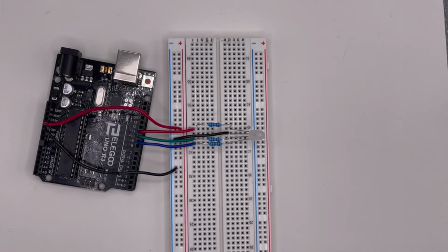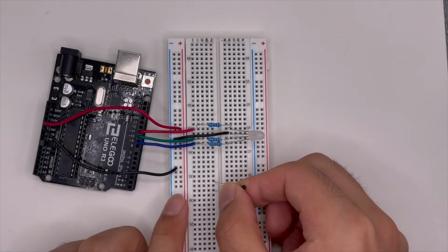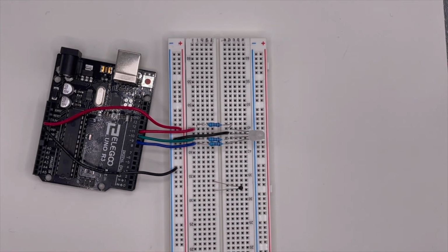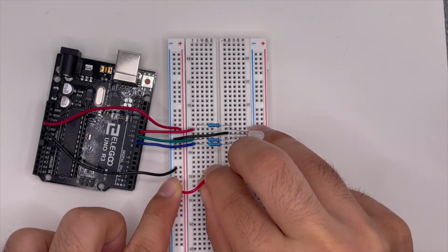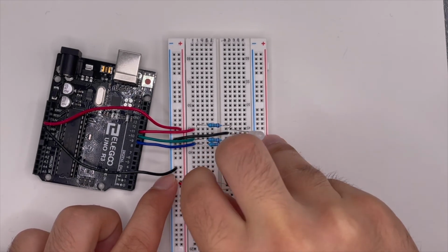It functions as a resistor, so the order doesn't really matter. We can just place it like this, just anywhere you want, as long as the legs are in two separate lanes. And of course, we need to power the sensor. So let's connect a power wire from the sensor to the positive bus line. So from here to here. That way we can make a circuit through this.